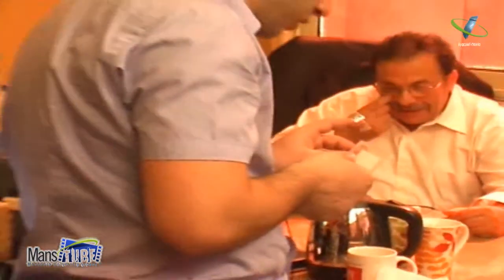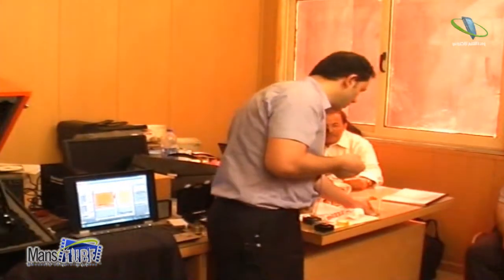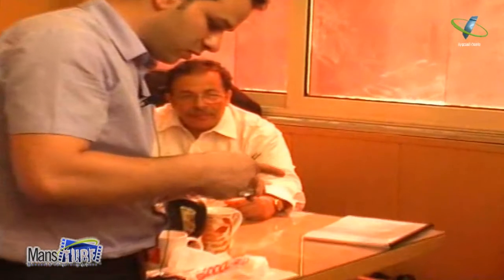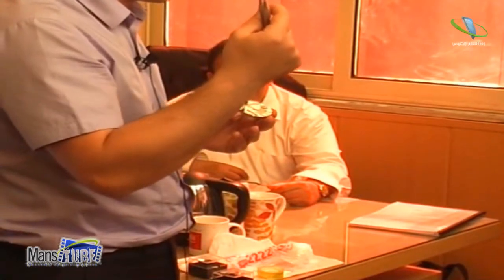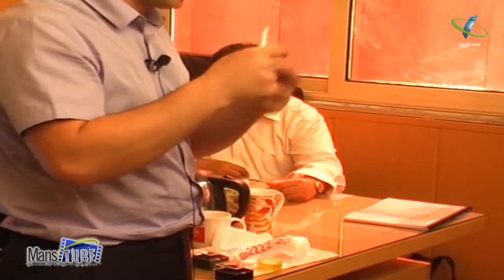Usually you can also use HOPG. With HOPG you can do more or less the same as this one. You have HOPG here, and again, you can scratch it the same way. Okay? But maybe you see it better. You make it like that, and then also scratch it. So you see that I remove graphite. This is a graphite plane. And they got the Nobel Prize on graphene for that, just on this, you see? They just scratch these things, and then they get the Nobel Prize.